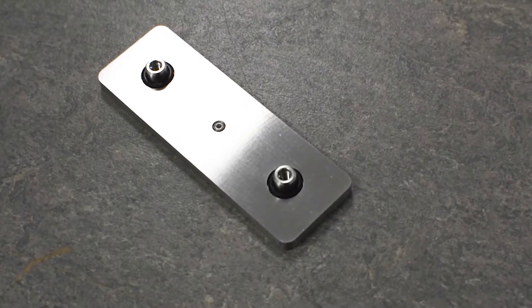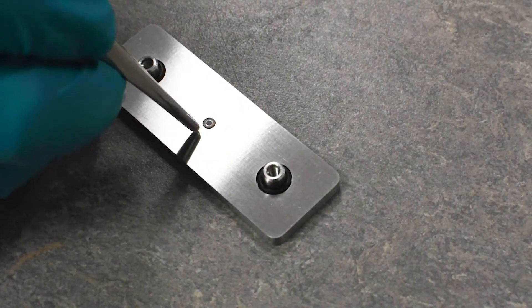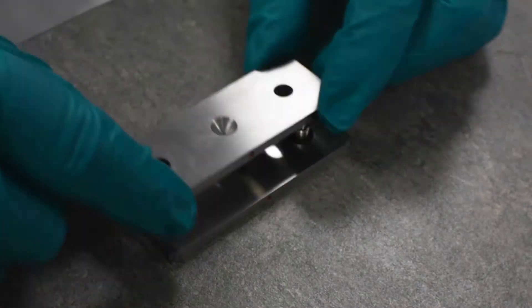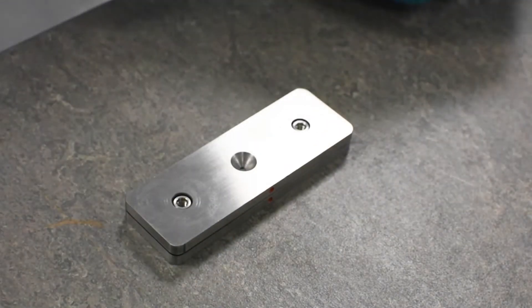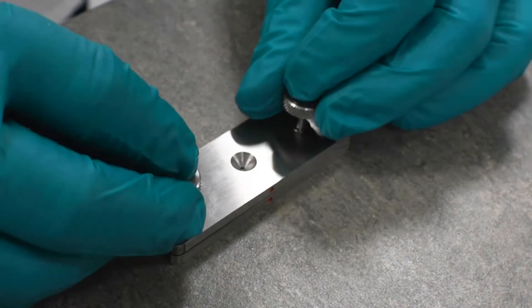To use the DC3, the sample is placed over the crystal. The top is then mounted and the thumb screws are used to crush the sample.